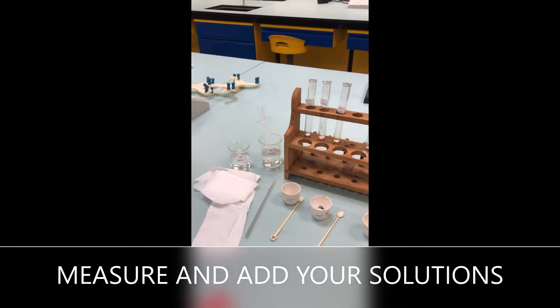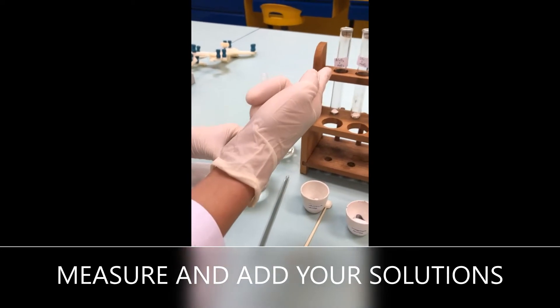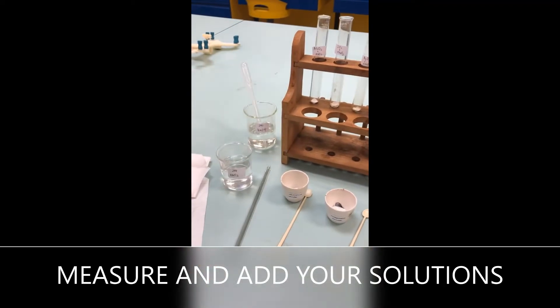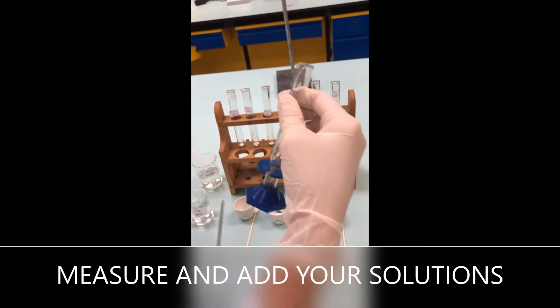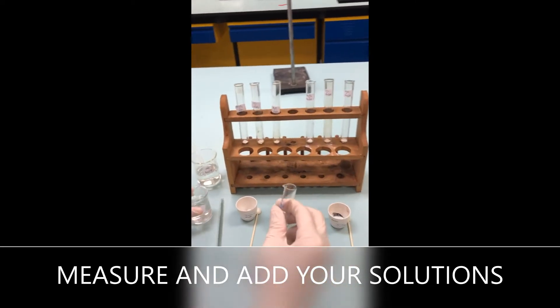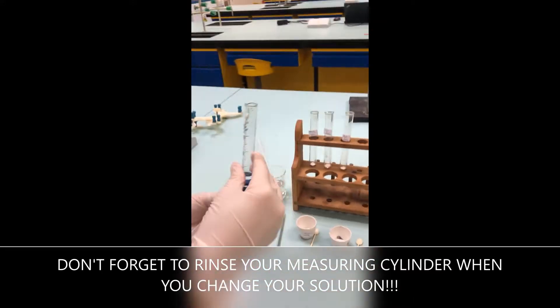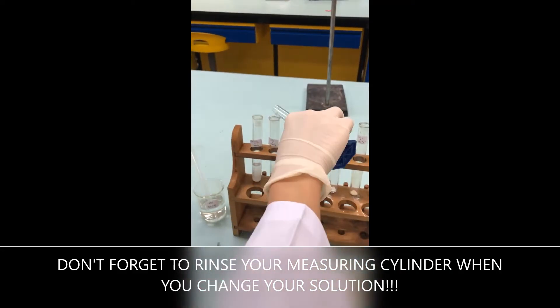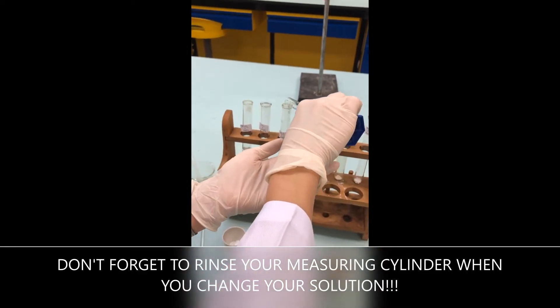Next I'm supposed to add the solutions into the test tubes as labeled. I will start with nitric acid first. You are supposed to put in 5 cm³. Make sure you read the meniscus correctly.